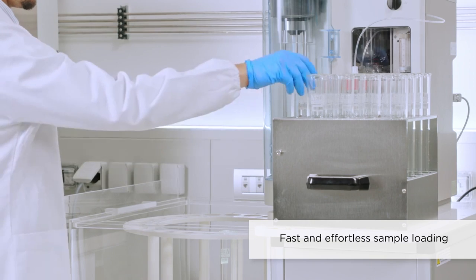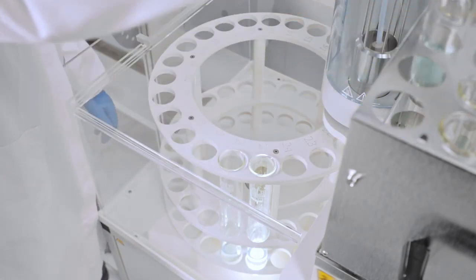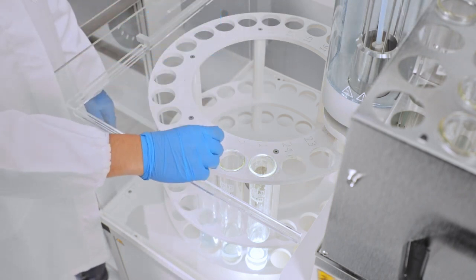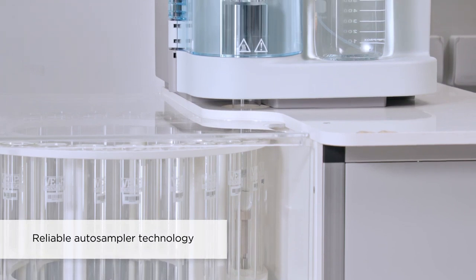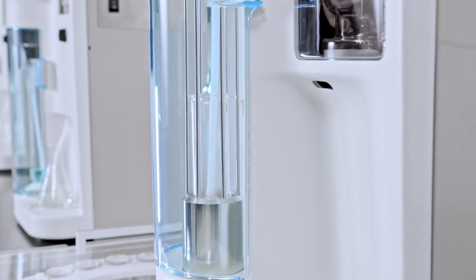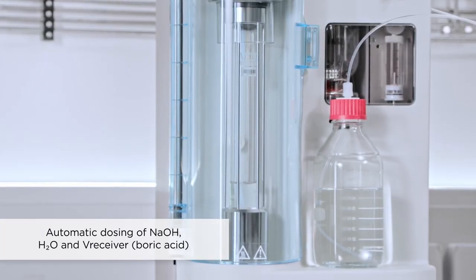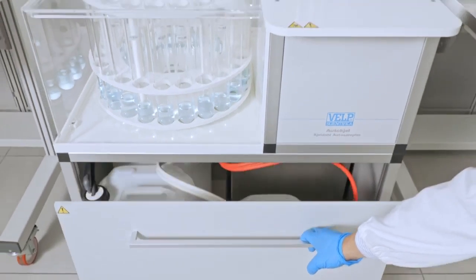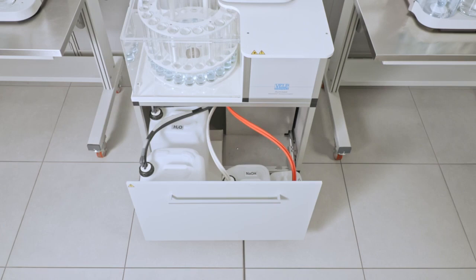Sample loading is fast and effortless, with a light showing where to place the test tube. The reliable Autosampler technology drives the test tubes from the carousel to the UDK169. The reagents are automatically dosed using high-precision pumps and burette, providing a simple and safe operation for reliable analytical results.